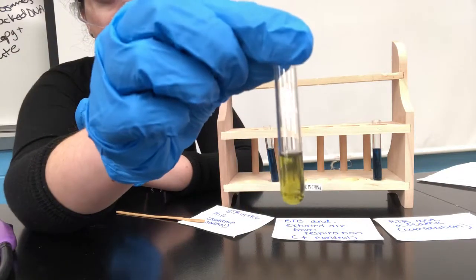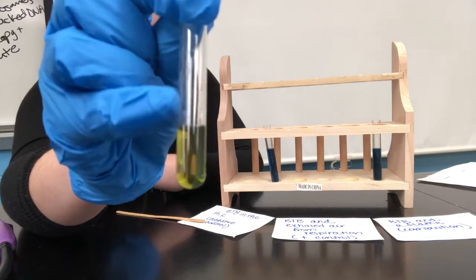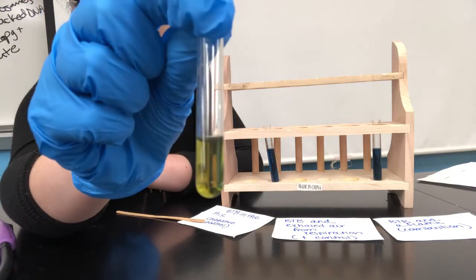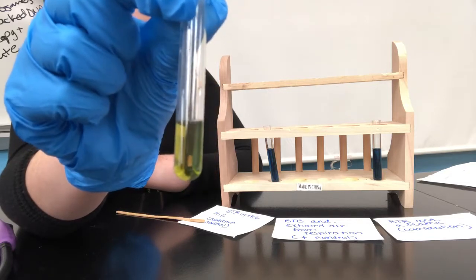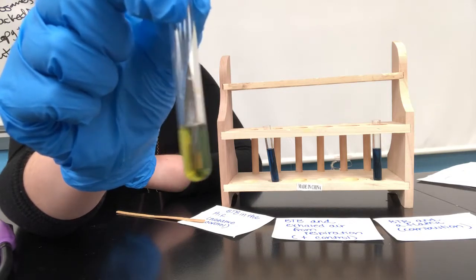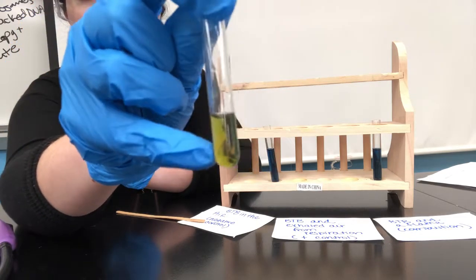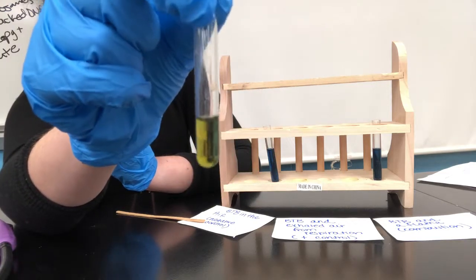Also, did you notice when I was exhaling into this tube, the straw was submerged into the liquid, so the air was getting down into the liquid and bubbling up. So you're going to want to keep that in mind when you transfer your carbon dioxide over to your algae. If you just leave the tube with the carbon dioxide above the surface of the liquid, it might not make it into the liquid as much as you would want. So this is a nice technique that you need to keep in mind when you design your farm, but that's going to be the next step.